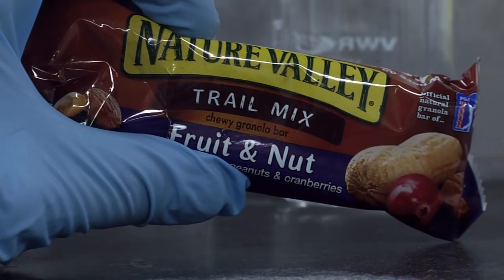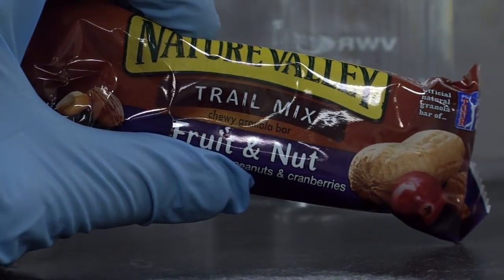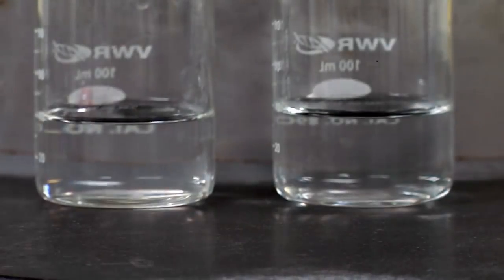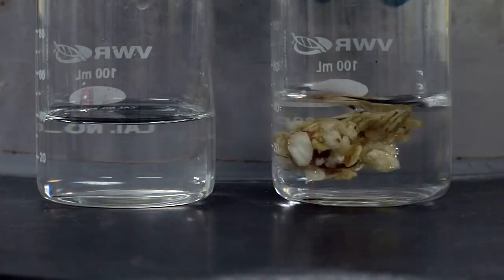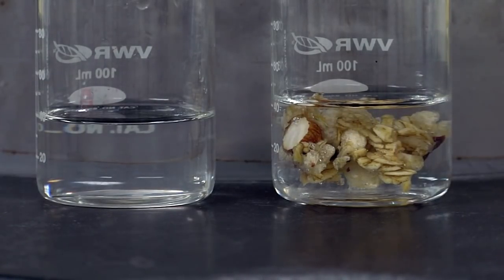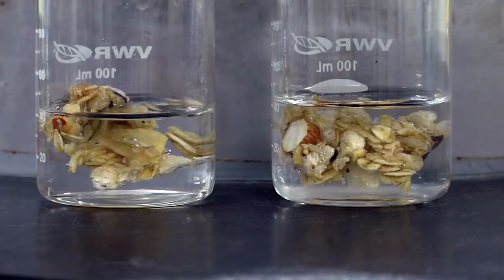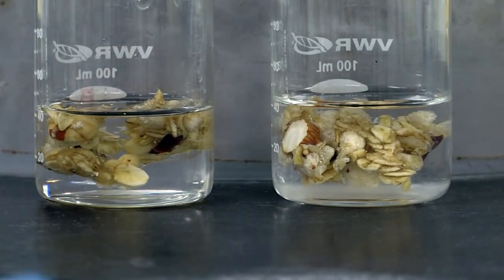Now, I've brought along a little bit of this Nature Valley granola bar in order to illustrate the effects of difference in concentration. What happens if I put a little bit of this granola bar into the hydrochloric acid, which is at a very dilute concentration, versus if I put a little bit into the hydrochloric acid at a very high concentration. Now, remember, don't try this at home.